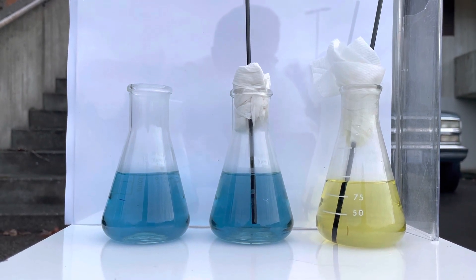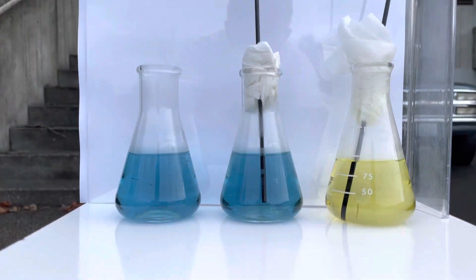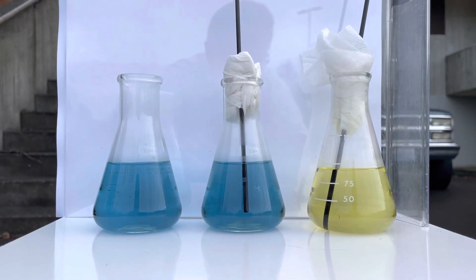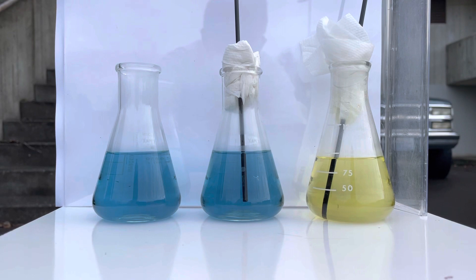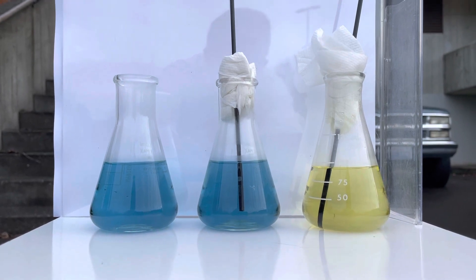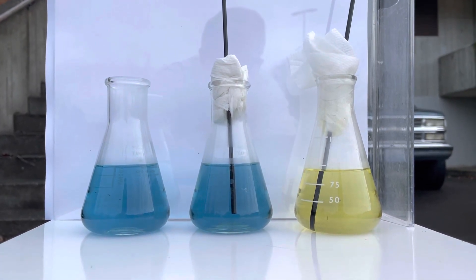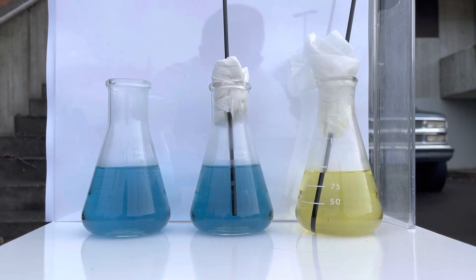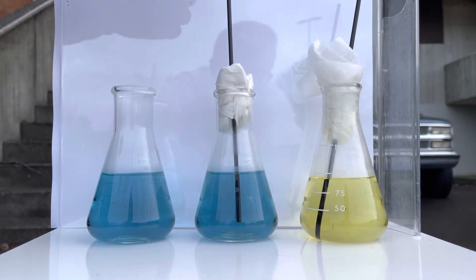We are not going to be timing it here. You're going to have to time it yourself, and that's where collecting the data comes in. Your goal is to time how long it takes for the middle beaker to turn from blue to the same yellow color as the one on the right. Are you ready, Mr. Matty, to exhale into the middle tube? All right, slow and steady.